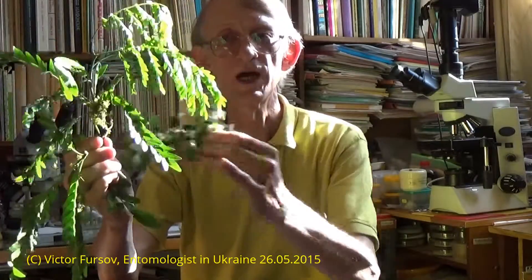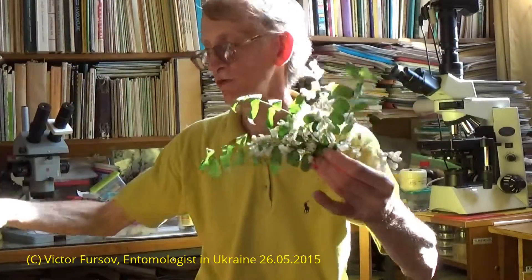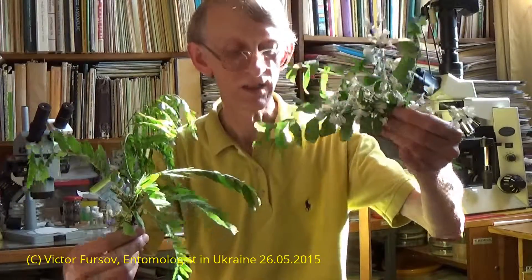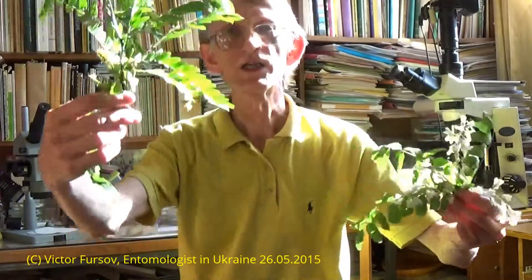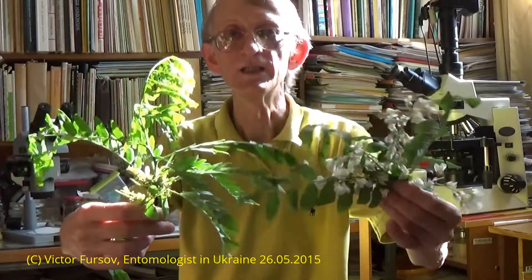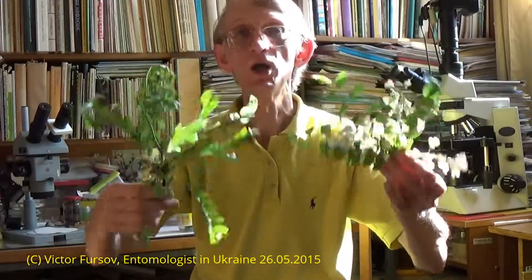So you can recognize this plant of Gleditsia — that's the scientific name — or Honey Locust Tree. Honey Locust Tree and these tiny inflorescences were here, near the beginning of a branch. And you see, they are absolutely different if you compare Honey Locust and Robinia Pseudoacacia. Robinia Pseudoacacia and Gleditsia triacanthos are important plants for honey collecting by your honey bees. And if you are interested in how pollen of these two different plants looks like, I will show you it under the high magnification of a microscope, under magnifications of 100, 200, and 800.